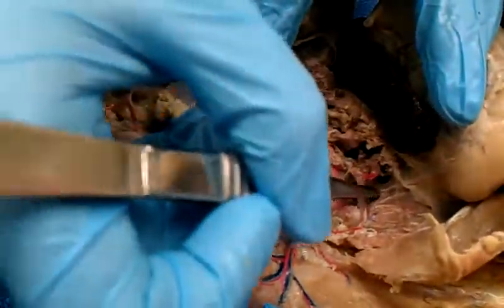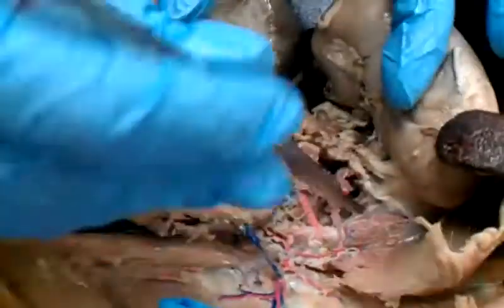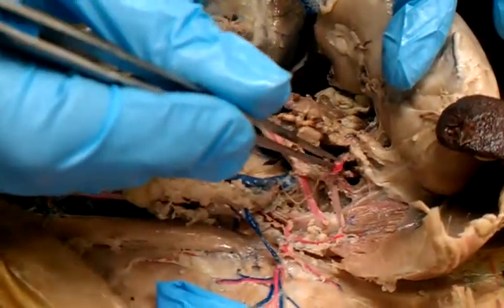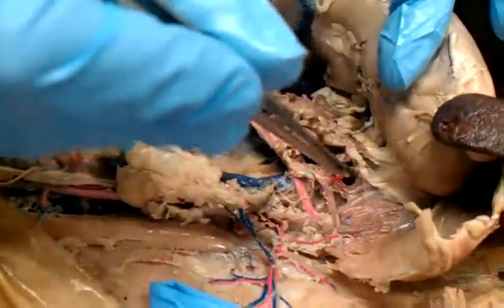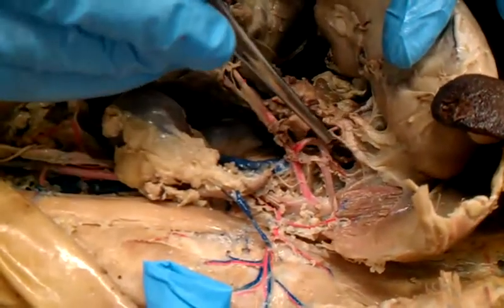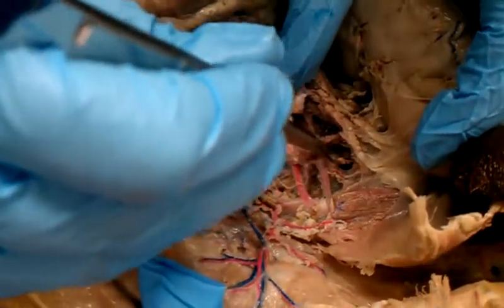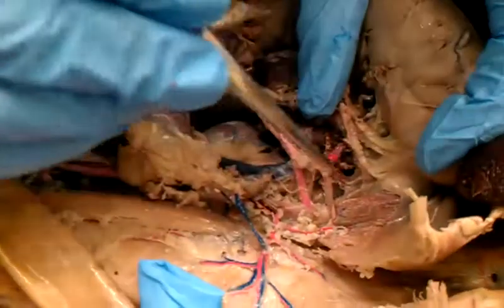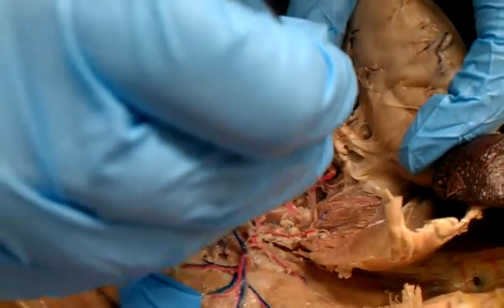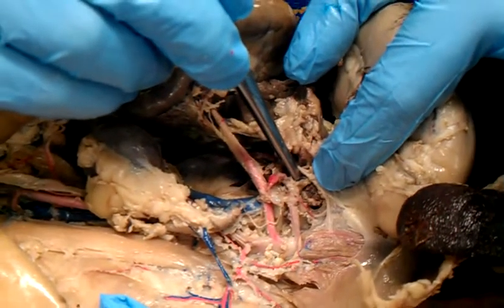And then, shoot, this is our celiac. This, let me move the spleen because it doesn't look right. Okay. This is the celiac. This right here is going to be the splenic. It's supposed to be connected to our spleen. This is the gastric, right? Mm-hmm. It's going to the stomach. And then underneath that, I don't really know where it differentiated. Okay, underneath that right there, I don't know if you can see that, is going to be the hepatic, going to the liver.